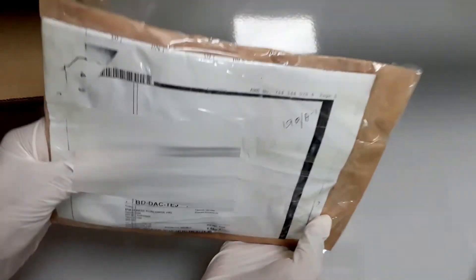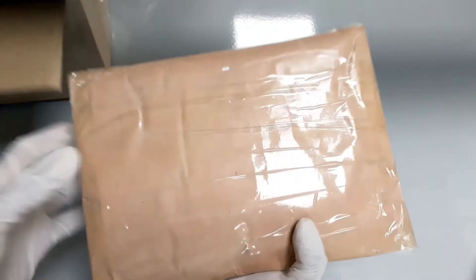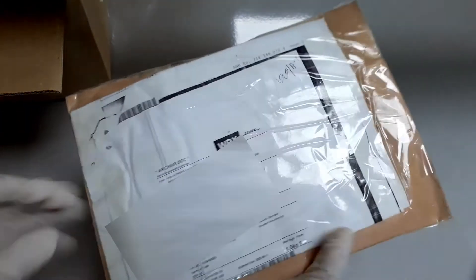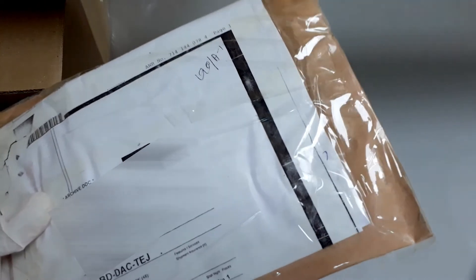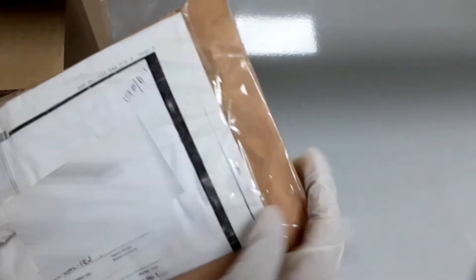I got a wrapped envelope with some documents attached to it. I am just going to open the envelope now.